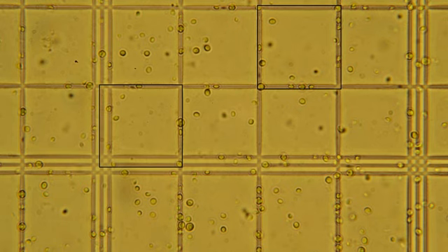This is an actual hemocytometer with our cell sample. First, we find a large top left square. Now that we have found the top left square, we will move to the right and down to find the center square. Given the high cell density in this sample, we will want to use the smaller squares for counting. It is important to count squares that are randomly spread across the counting area. You will want to choose 10 to 15 squares at random and count the cells contained within them. It is okay if there are no cells in the square you picked, so long as you picked each square randomly.